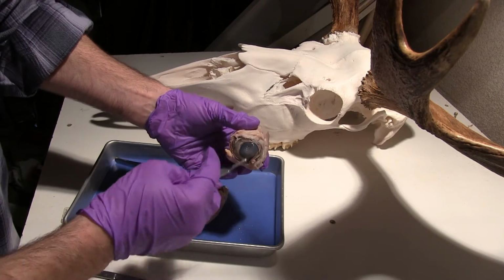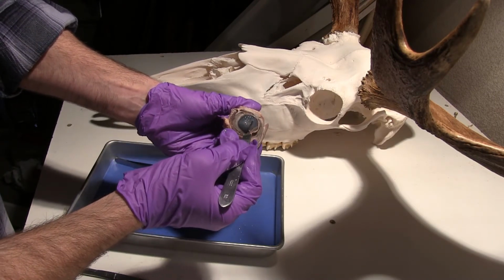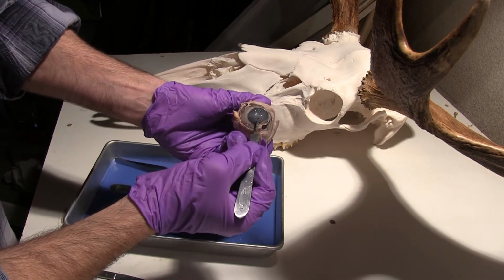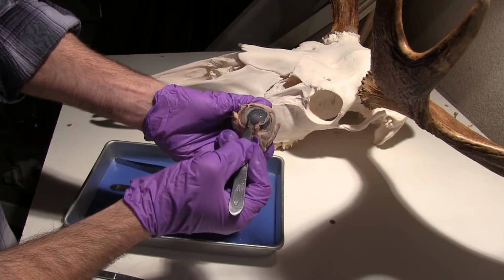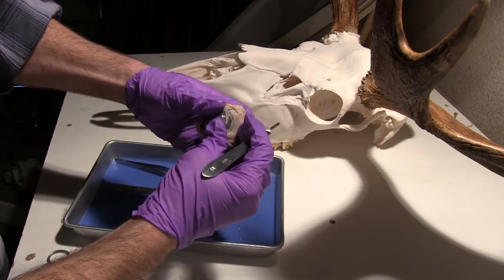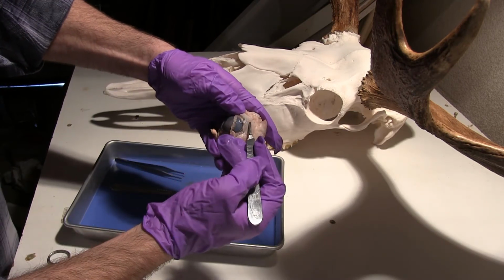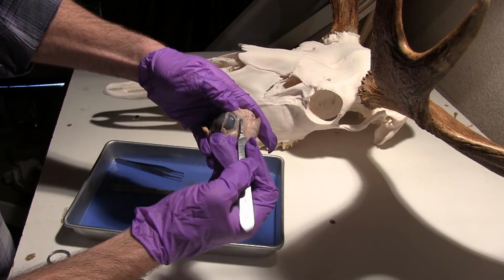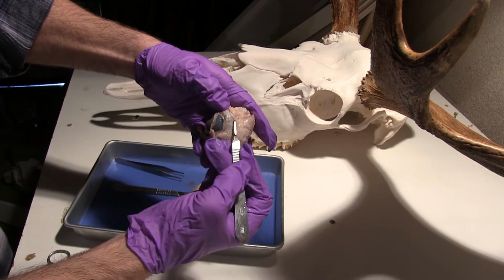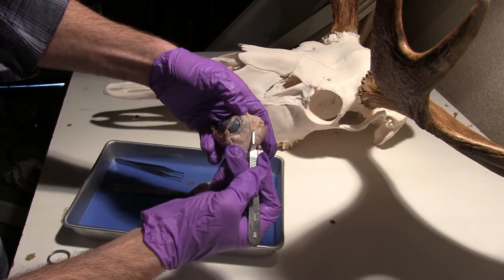So looking at that front area here, this is actually going to be called the cornea. So this is the main structure that we think about when we look at somebody's eyes. We're actually looking at their corneas. And then back over in this area, it's called the sclera. So that's going to be the protective layer that's up against the eye, inside of what we would see with inside of somebody's eyelids.